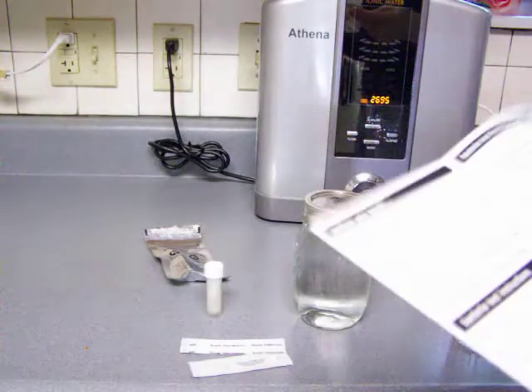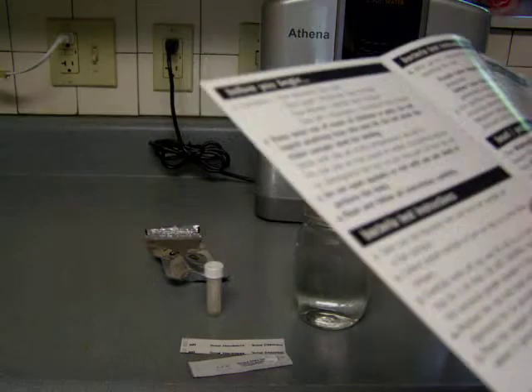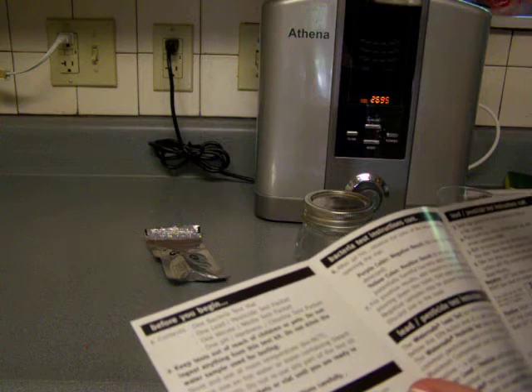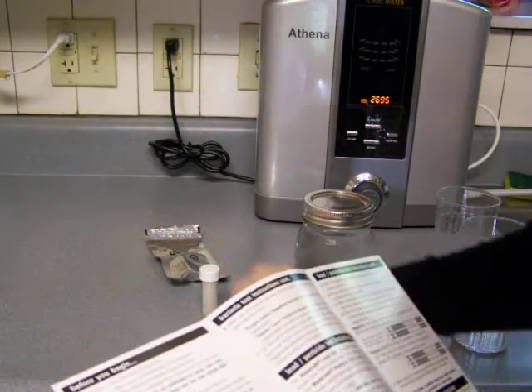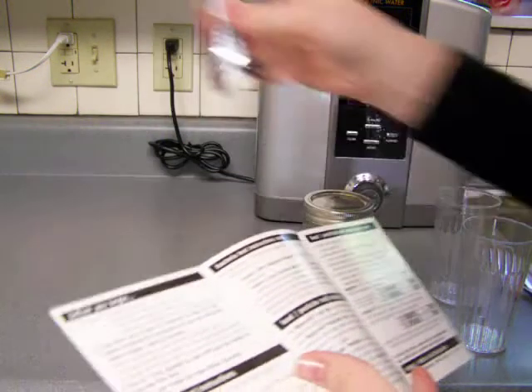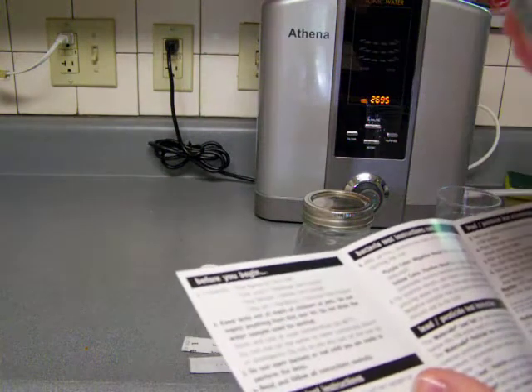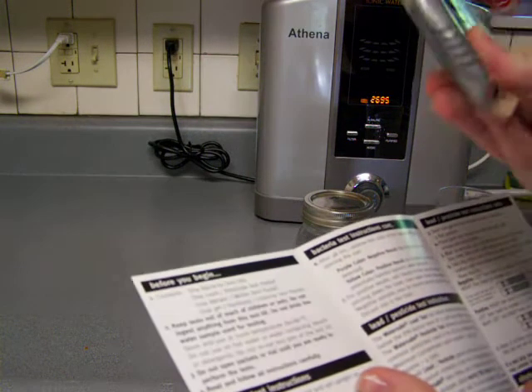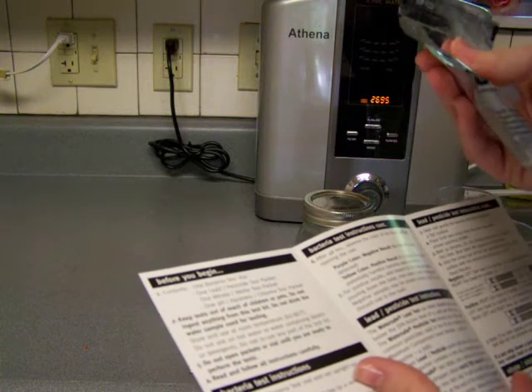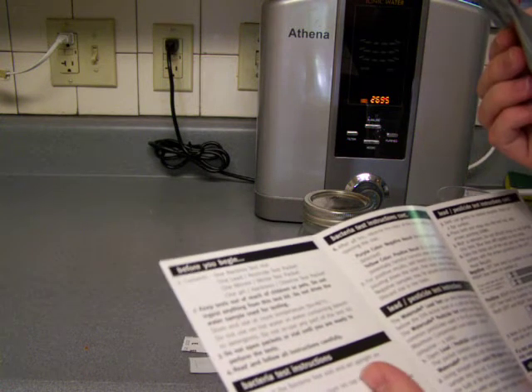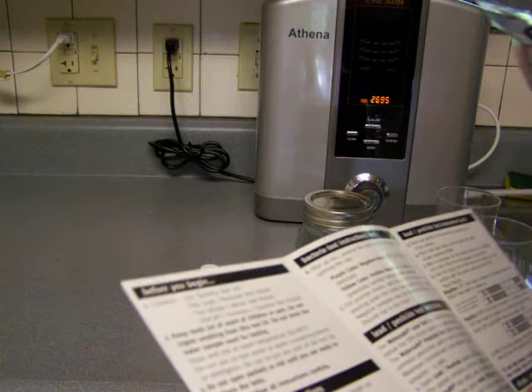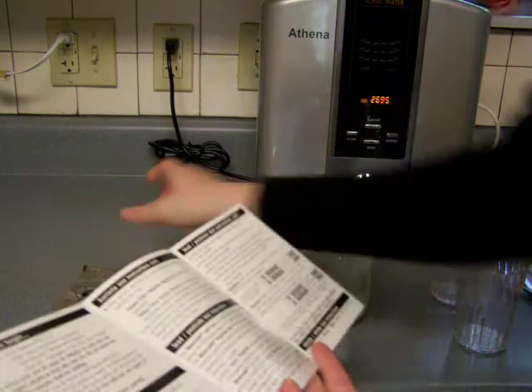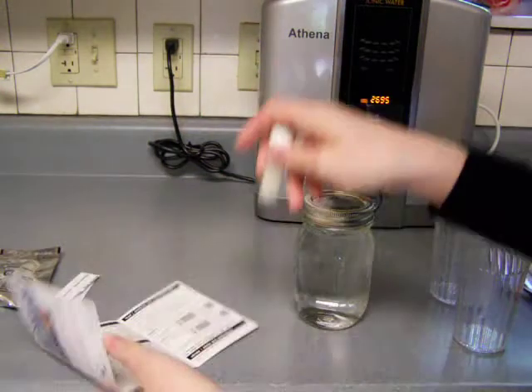So let's see here. Okay, so this is the bacteria test vial. And I guess it says this is the lead pesticide test packet. So let's start with bacteria.